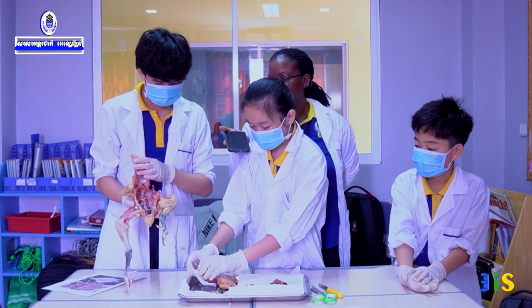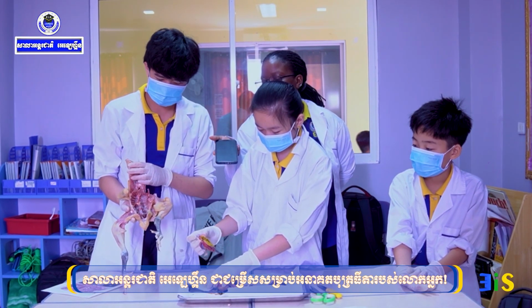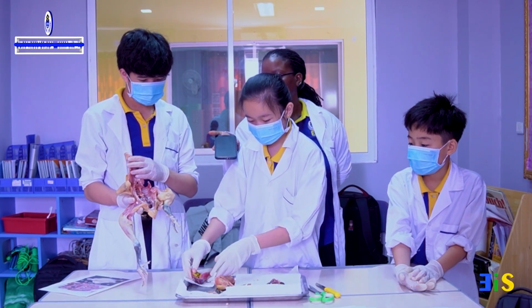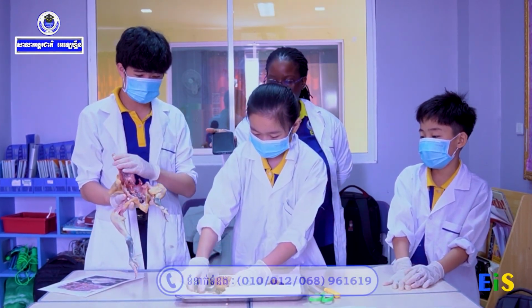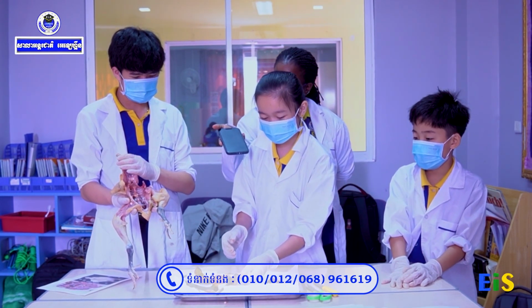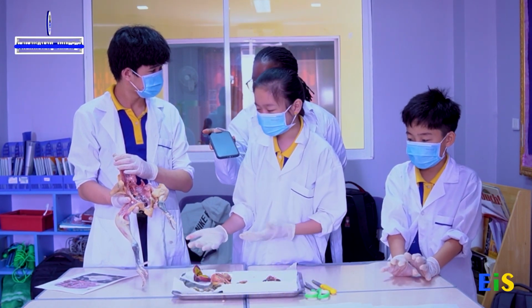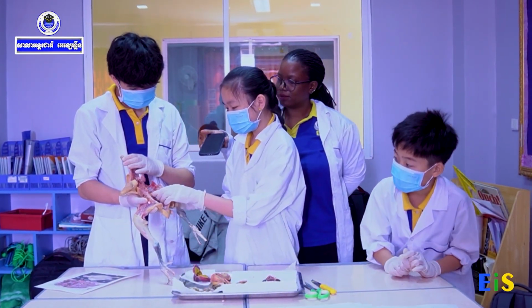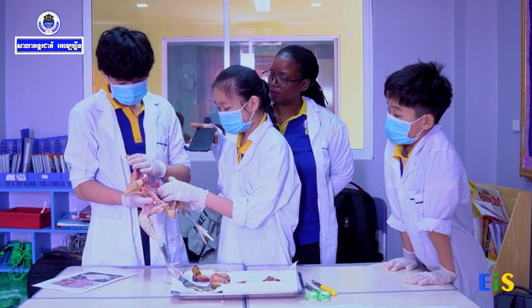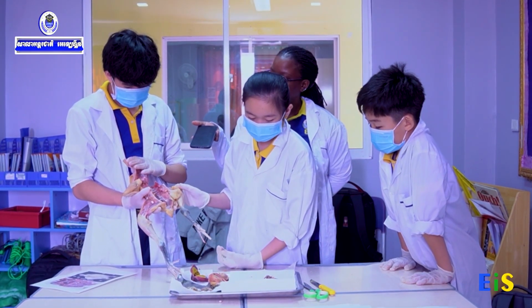This is the gizzard. It contains the trash that the chicken eats. Those are the small intestines. And this contains the poop of the chicken. The waste. This is the kidneys. It's very small. And these are the rib cage, which protects the internal organs.